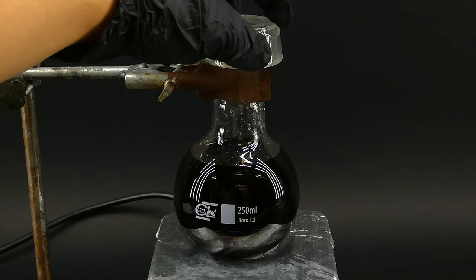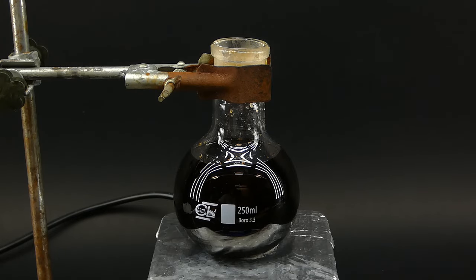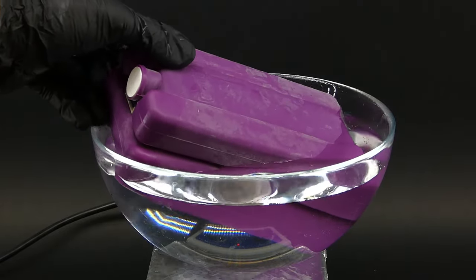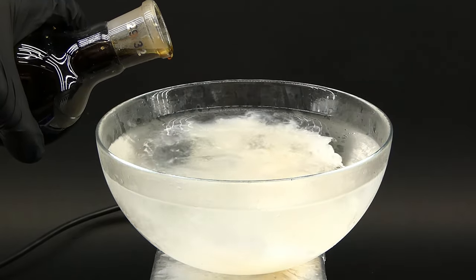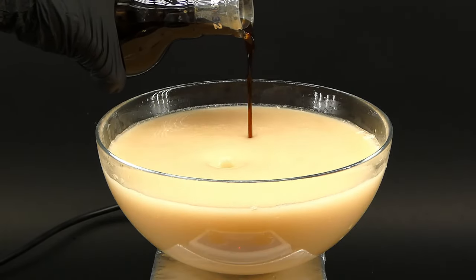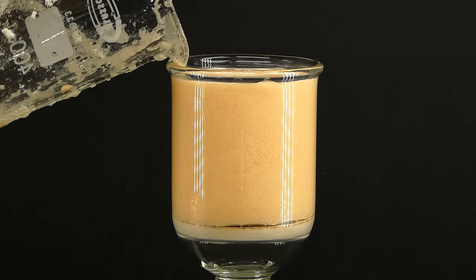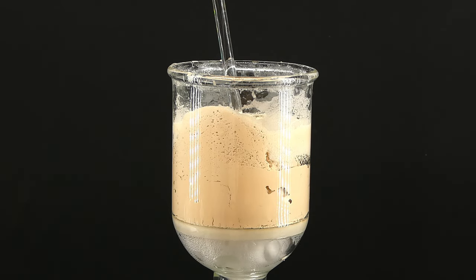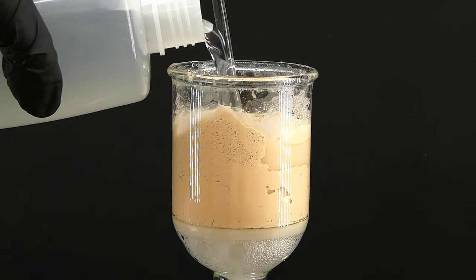When I came back, it had of course turned into black tar, and to separate my product from it, I got it all into some cold water — I set up a bowl with about a liter of distilled water and cooled it down using a cold pack and some distilled water ice. I slowly poured in the reaction mix, which instantly precipitated the product as a milky suspension. The water got slightly warm from all the sulfuric acid, and when I finished adding everything, I quickly vacuum filtered the whole mixture, leaving me with a lot of yellow filtrate and some lightly brown product. Before purifying it, I have to dry it because, despite being hydrophobic, it can hold on to a lot of water, and I'll have to do it using a vacuum.